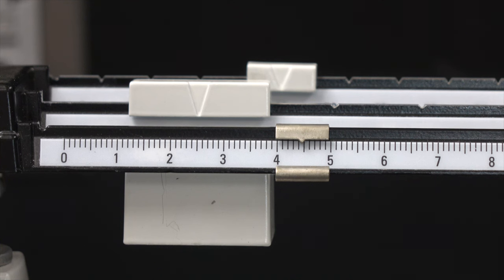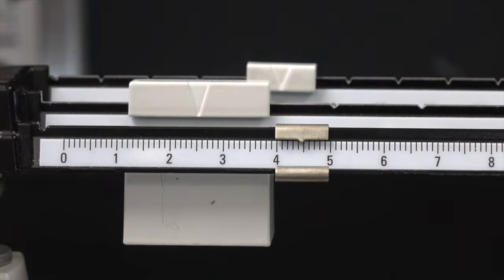Lastly, we divide the space between the two smallest marks, the 4 tenths and 5 tenths marks, into 10 even smaller imaginary divisions and write down, as our last digit, which of these imaginary marks the pointer falls on. I believe that the pointer rests on the sixth of those imaginary marks, making the reading on the front rider 4.46.